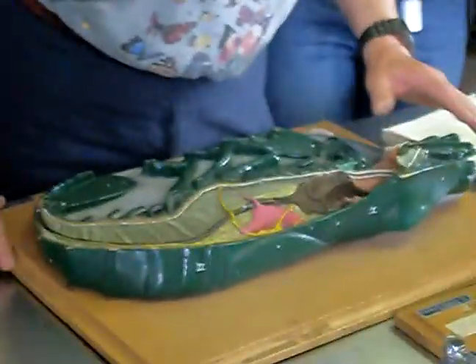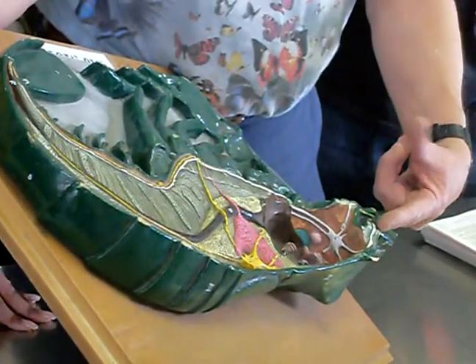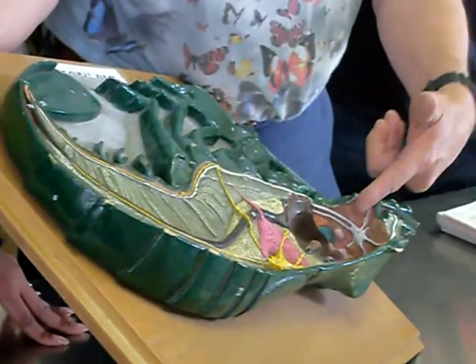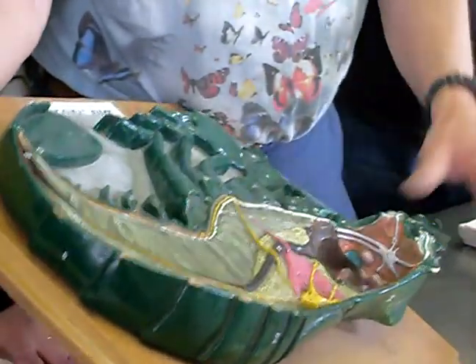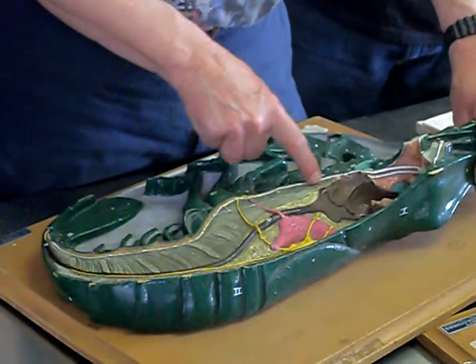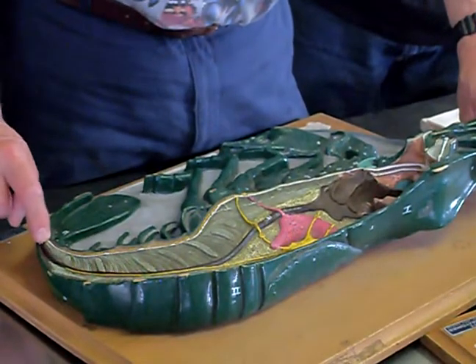So those are the sensory structures. In the head would also be the brain, which is this white structure that you see inside the head here, with various nerves going to structures like the eyes — the optic nerves — and the nerves to the antennae, the antennal nerves. This is the brain with nerves going to various sensory structures. That brain connects to a ventral nerve cord, which is the white structure running the length of the body, going all the way down here to the end of the tail.